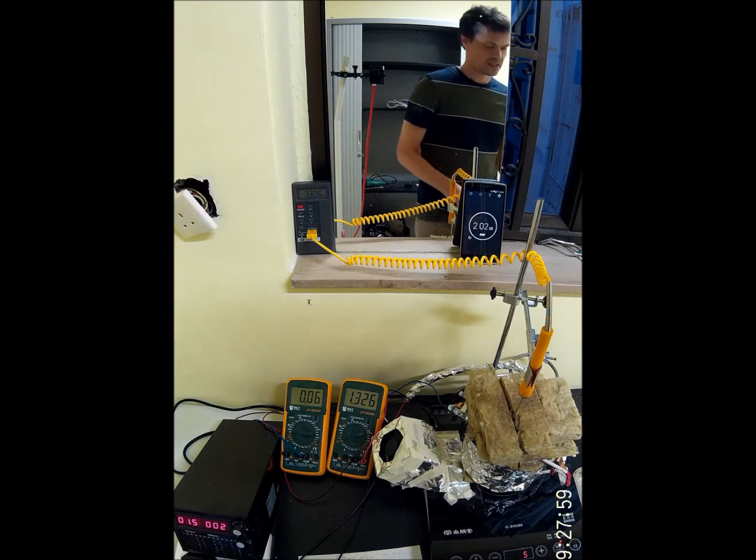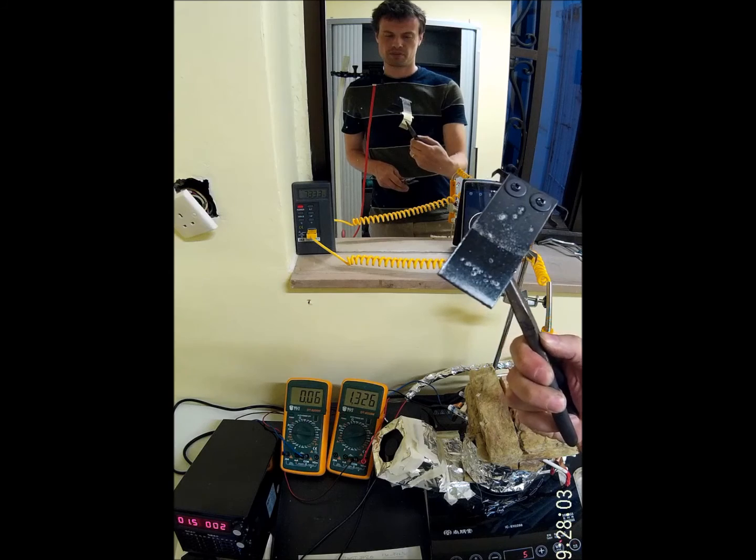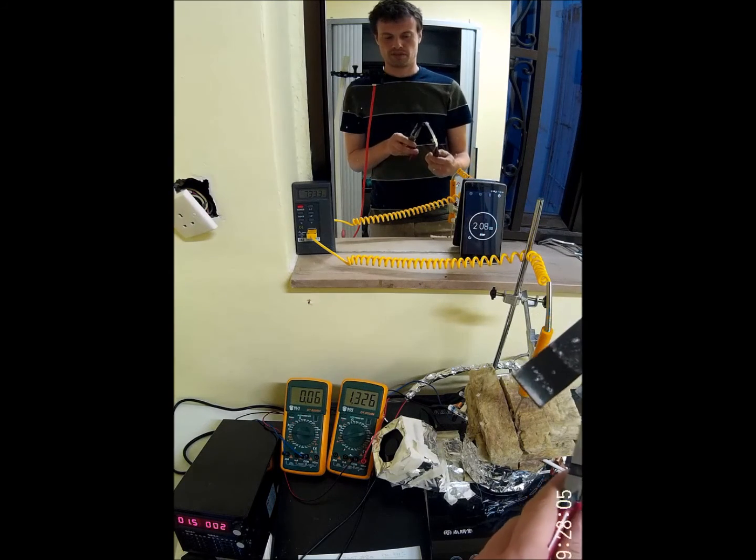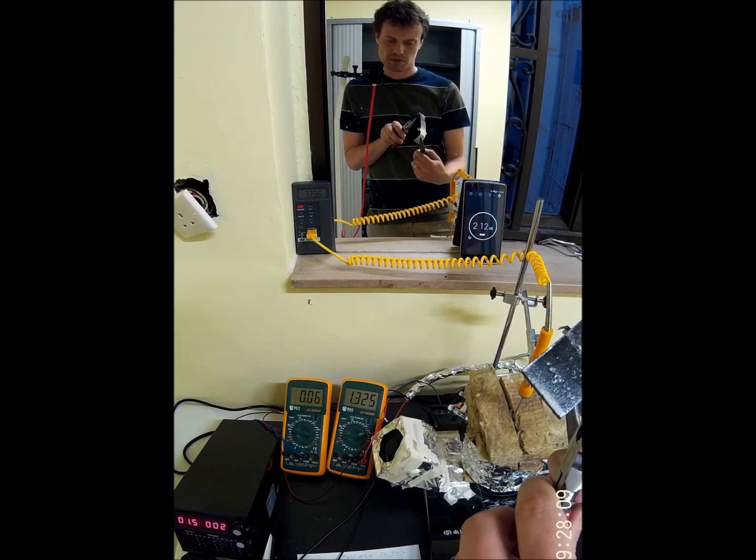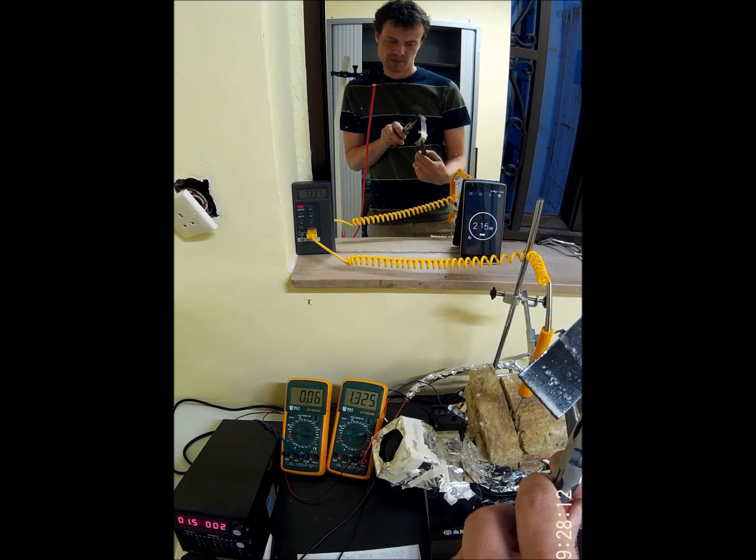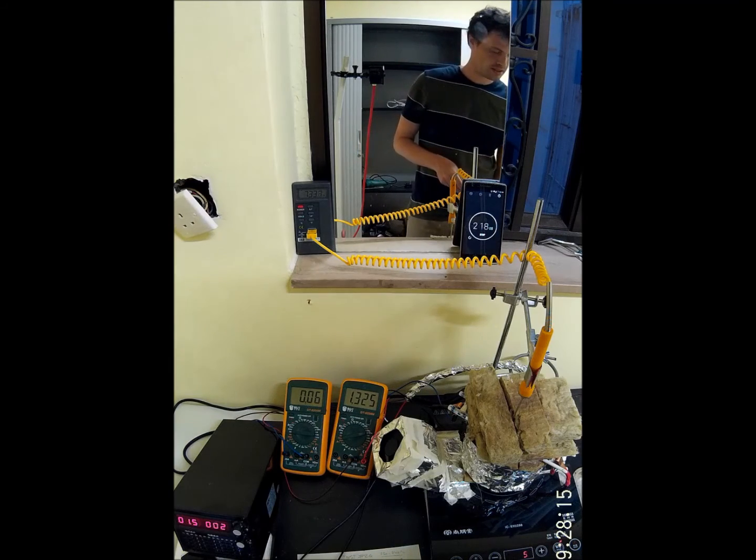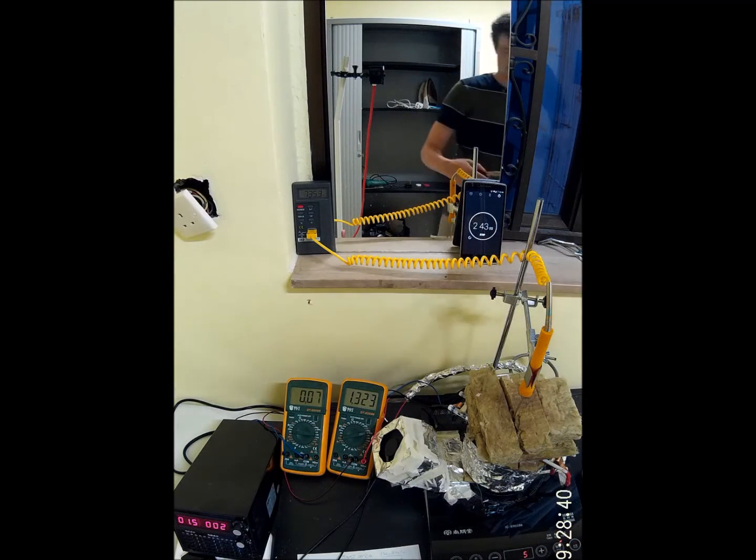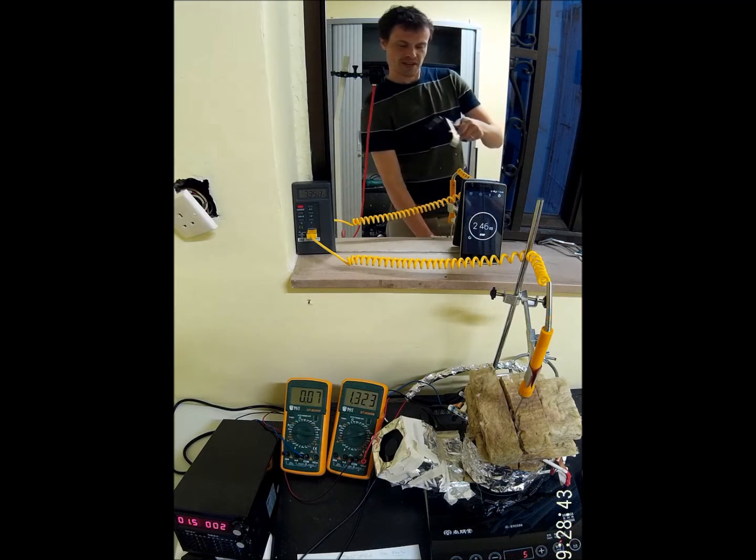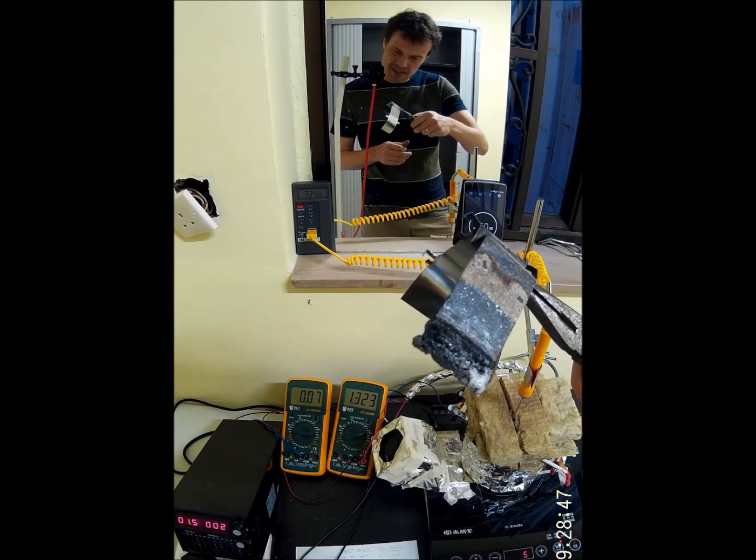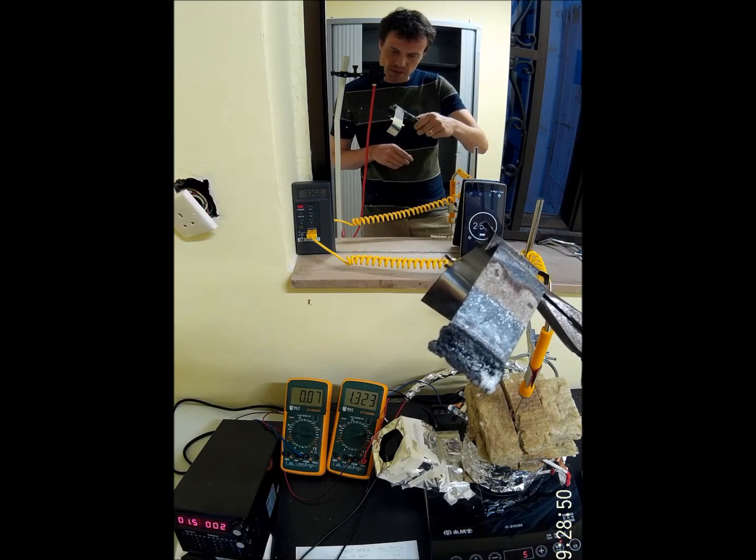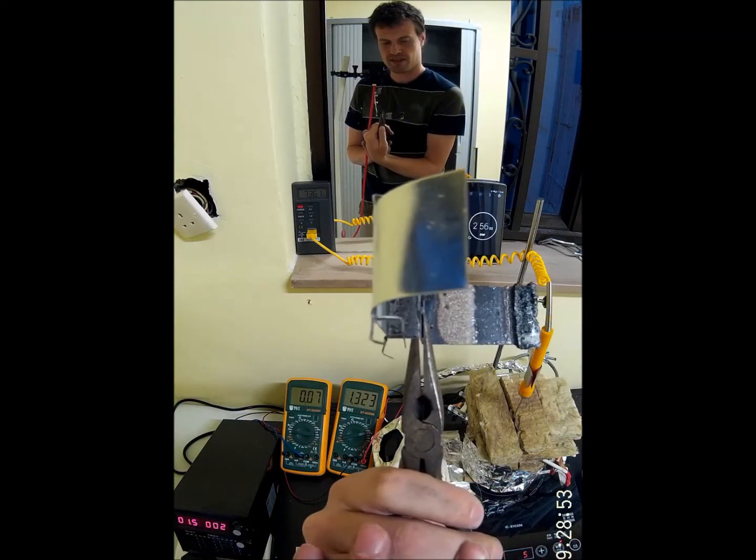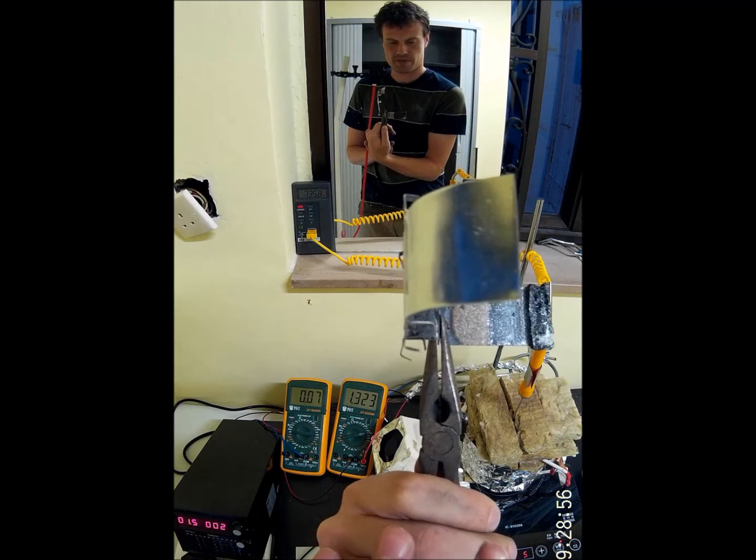This is the nickel anode. There's nothing there, just a bit of electrolyte. The lithium carbonate left, it's the white thing. And then the cathode. Yeah, now it looks nice and black. There's some white lithium carbonate there. Otherwise, yeah, nice layer of carbon.